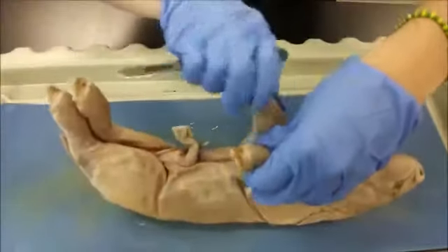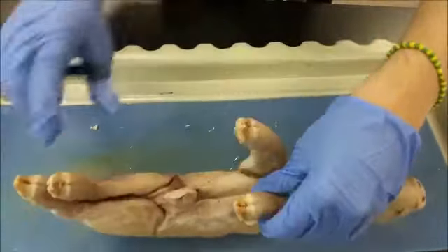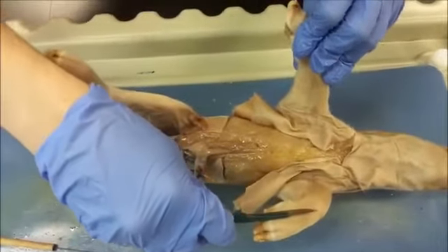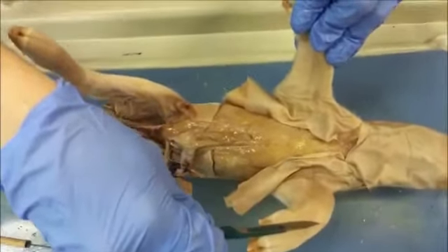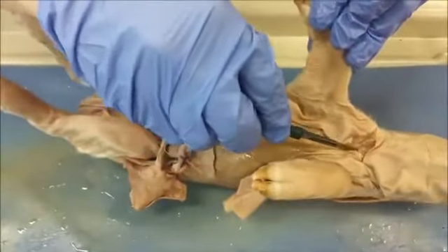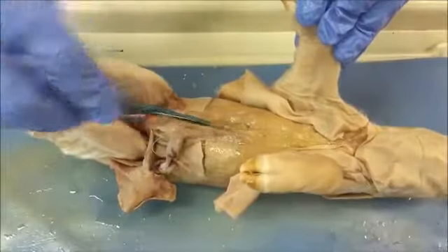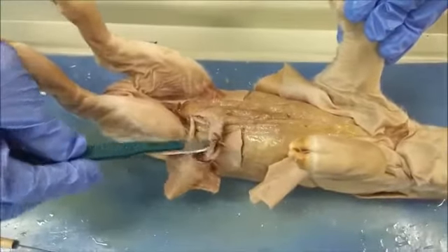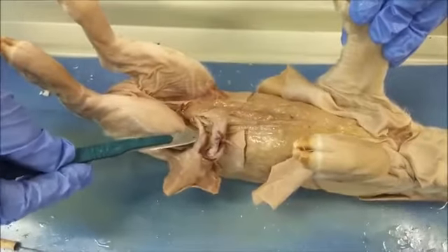It's going to be the worst to try and open there because he's flat like a pancake. Okay, we have currently cut past the skin. We can now see muscle. Yeah, this will be the thoracic muscle. Here would be the sternum deep to the muscle. Then here is, with the skin torn away, the umbilical cord, and then this will be the urethra.